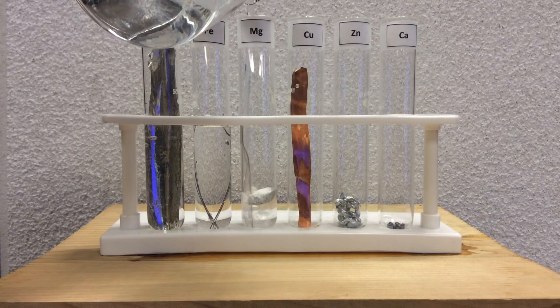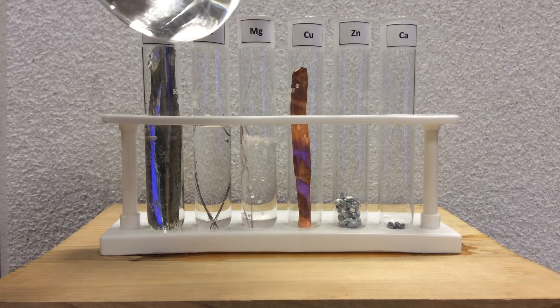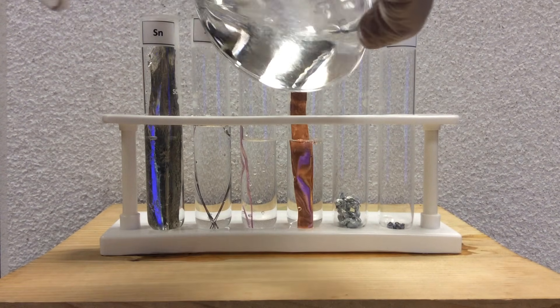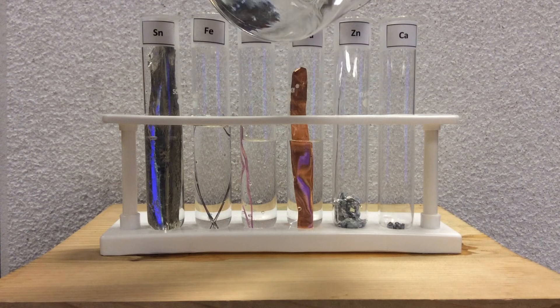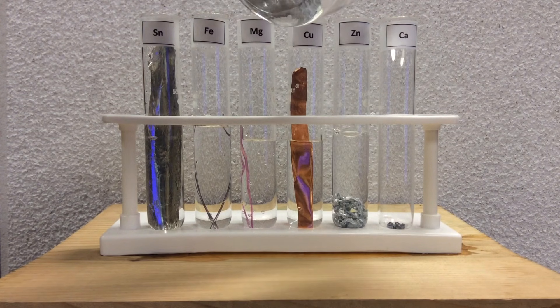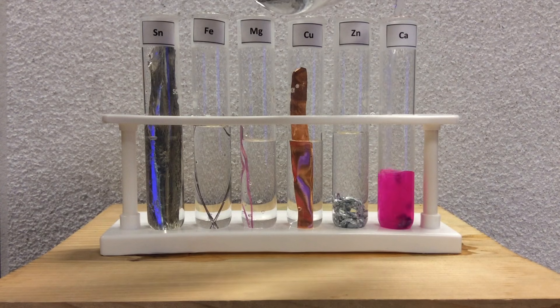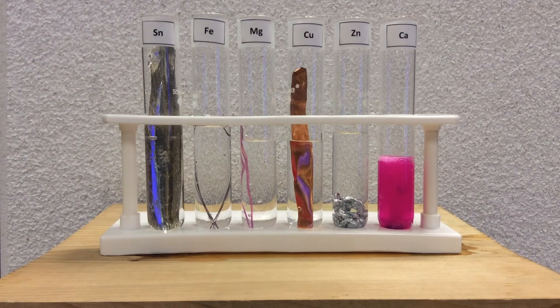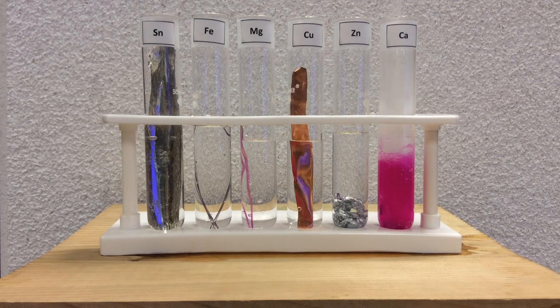It will not be as vigorous because, as you know, there's just not as many free protons in water. Water is not a very good electrolyte. So the reaction is not going to be as vigorous. And, of course, what's happening is the metal is trying to give an electron to the hydrogen of water, which is essentially a proton. So it's being held by the water a little bit. So you're not going to see as vigorous a reaction.